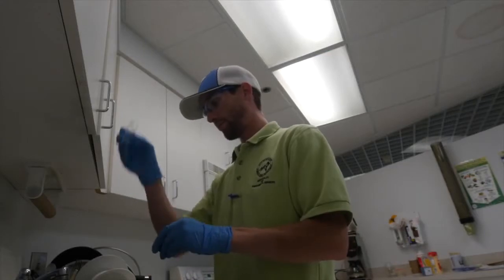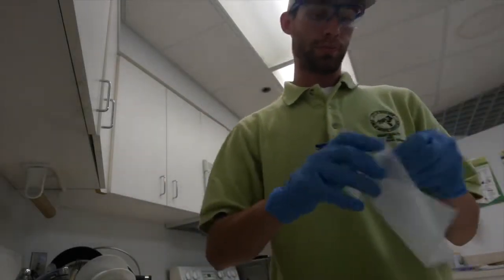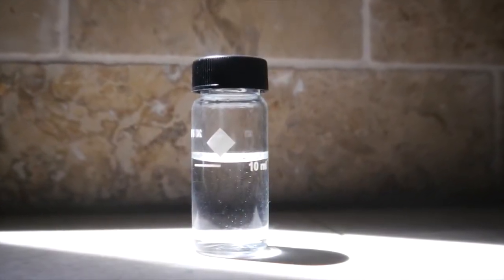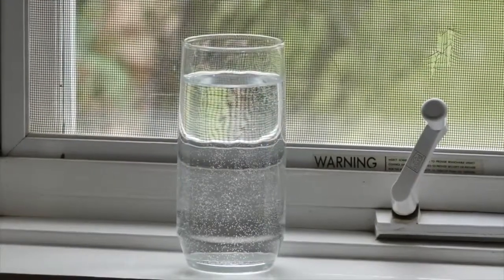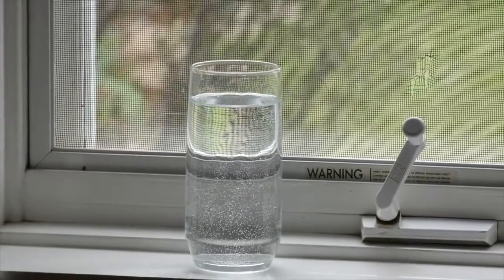Chlorine residual measurement is best if performed immediately, as chlorine is very reactive. The longer a sample sits, the more likely that the concentration will decrease. Never leave samples out in the direct sunlight, as chlorine will photodegrade quickly.